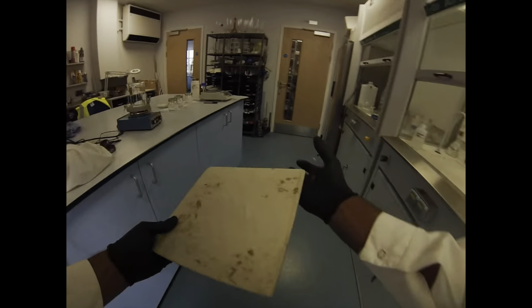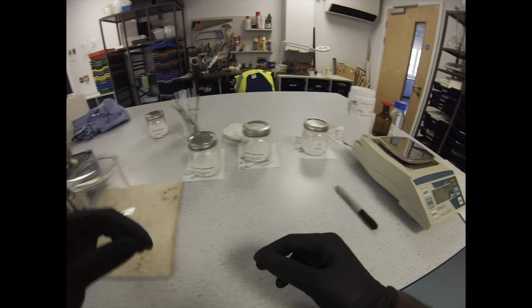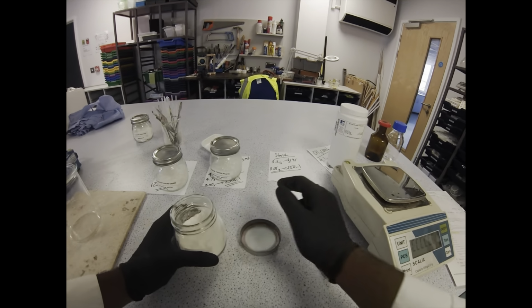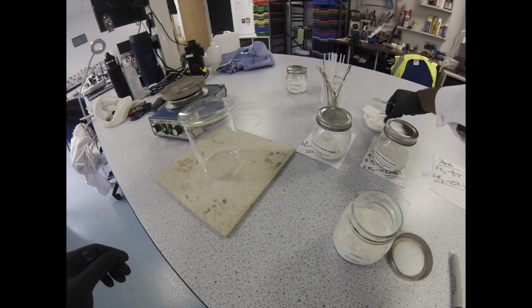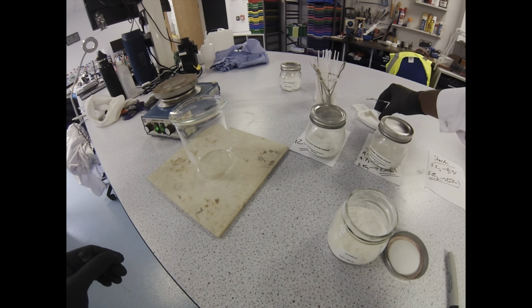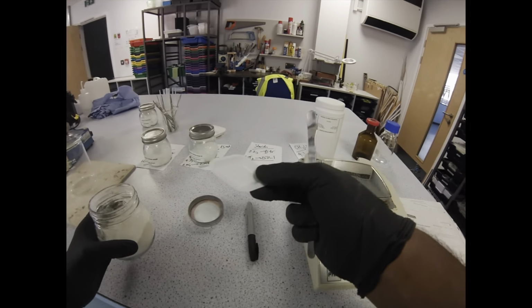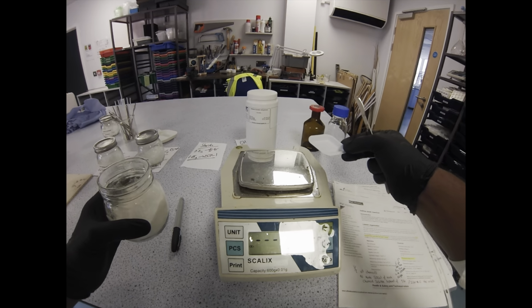Now the starch is going to react with the iodine as the iodine's formed and give us that really nice deep blue-black colour. A nice little demonstration if you're doing introductions to enzymes and using starch as the indicator for a starch amylase reaction. But actually I have a little tweak on this reaction and the starch amylase reaction, which I'll show you at some point, which is a bit more relevant to what they're learning when they're doing biology.